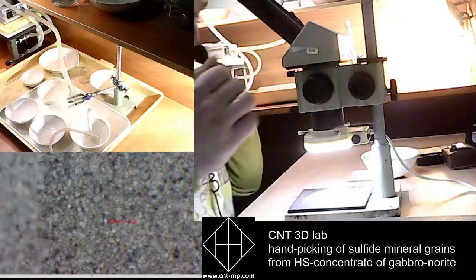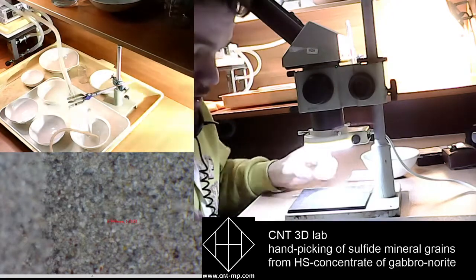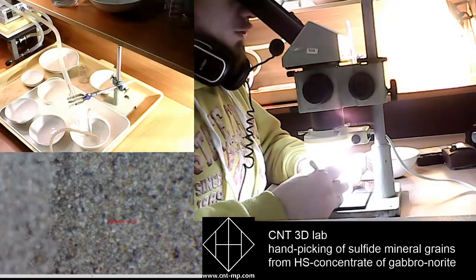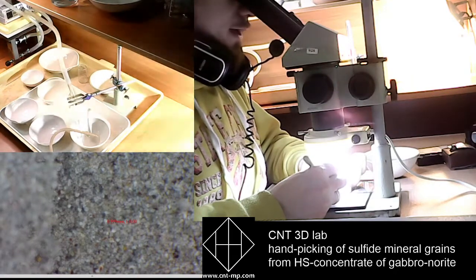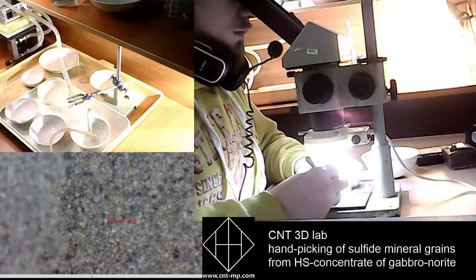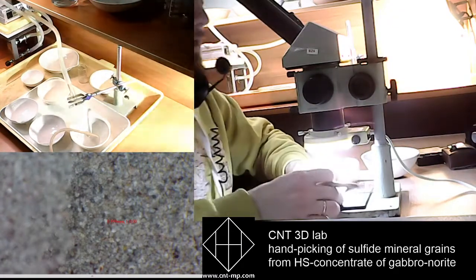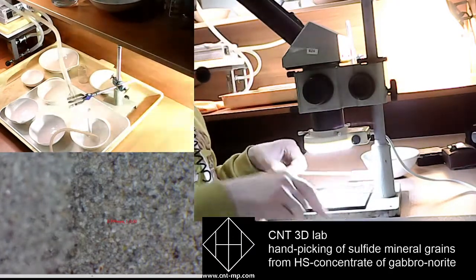So this is a fraction. We are working with a fraction of 0.5 to 0.25 millimeters. To select the grains of sulfide and collect them in a special container, we use a steel stick, a stick made of steel, or a wooden stick.